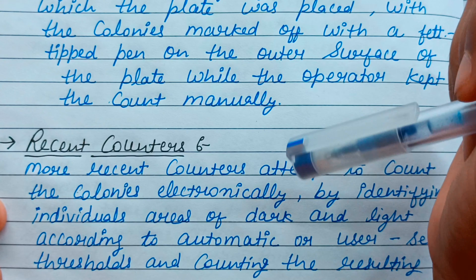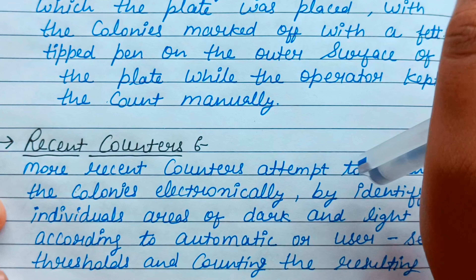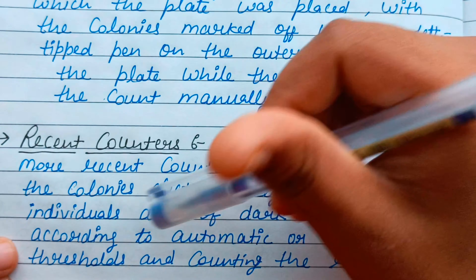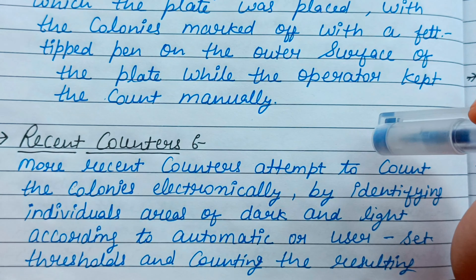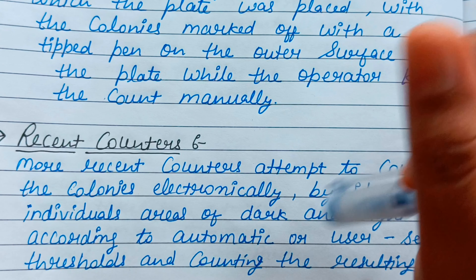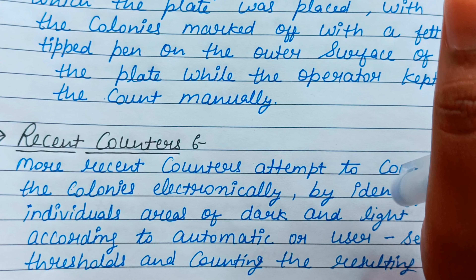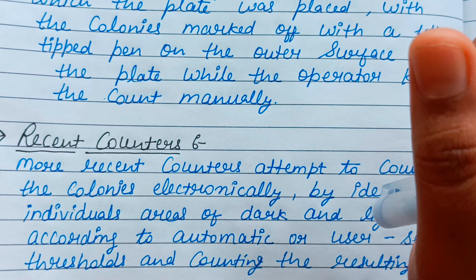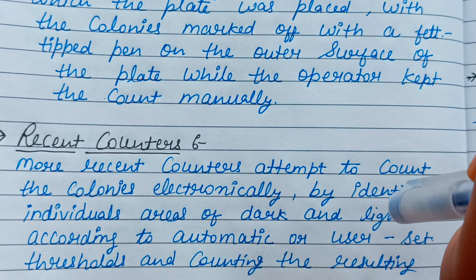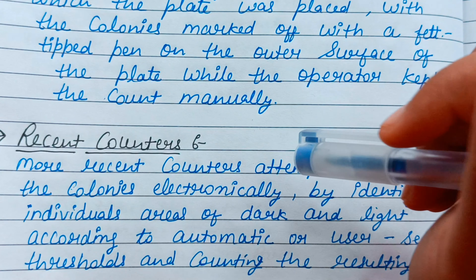Now let's talk about the recent counters. More recent counters attempt to count the colonies electronically by identifying individual areas of dark and light according to automatic or user-set thresholds, and counting the resulting contrasting spots.